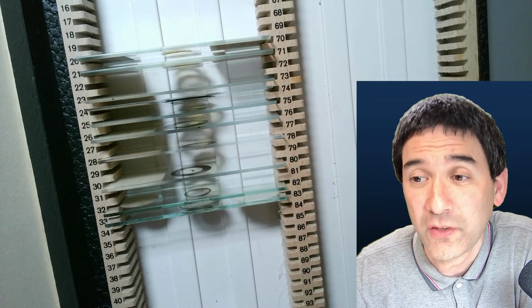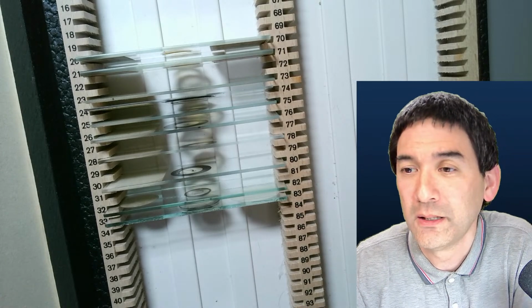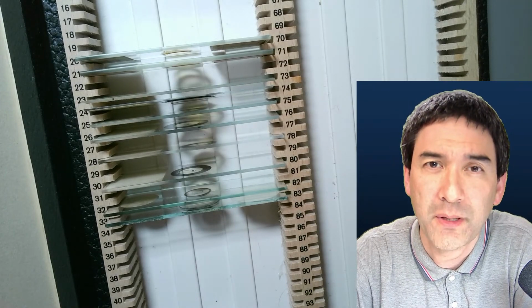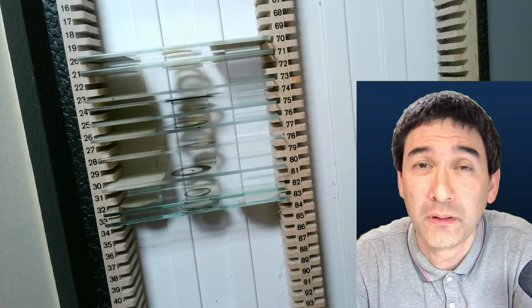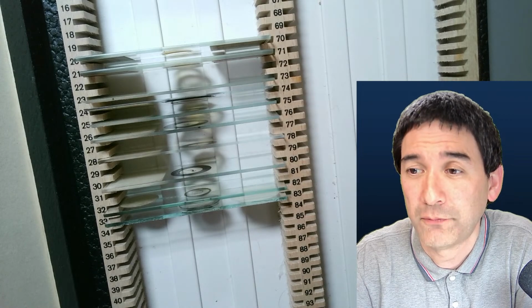The video was very briefly still. I hope that it works now. From Philadelphia, Pennsylvania, I mean. Okay, now it's okay. I hope that it works. There was actually a setting that the software recommended concerning the so-called delay. So there's a little buffer built in, and I hope that essentially the buffer doesn't run full.